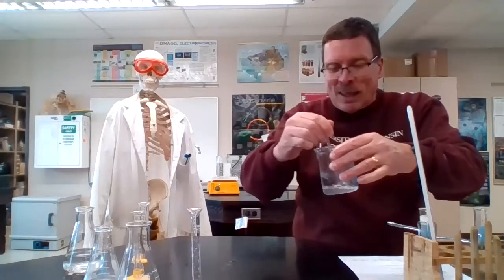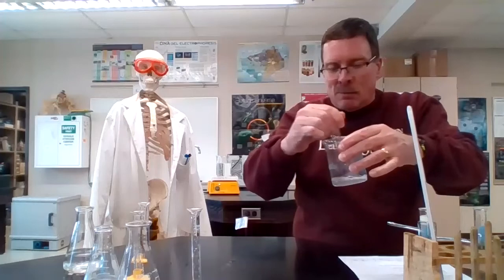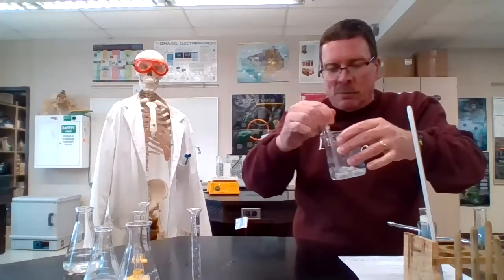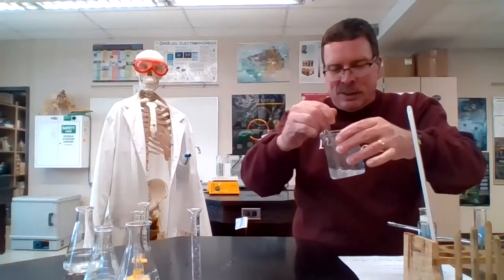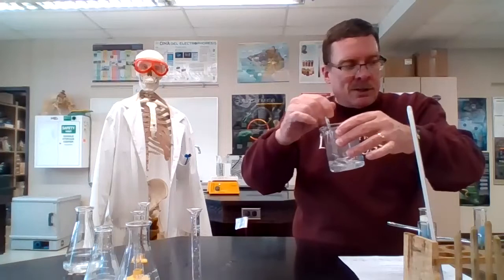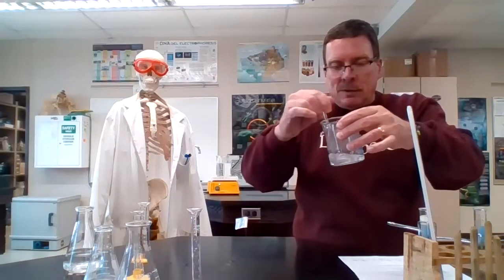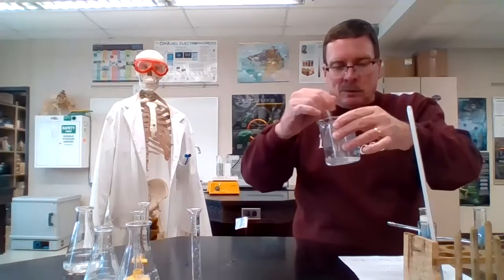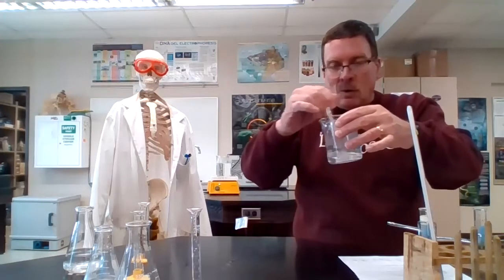Again, why? Because it's at a higher temperature, higher kinetic energy. More energy, more movement, more collisions at the appropriate energy level and orientation. We love reaction rate stuff. We hope we love it.